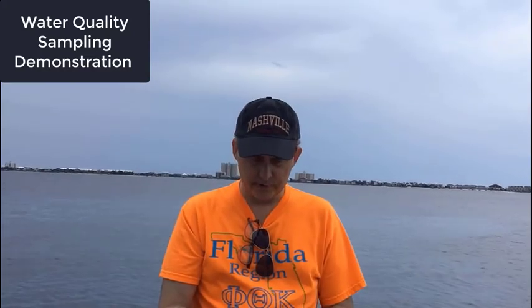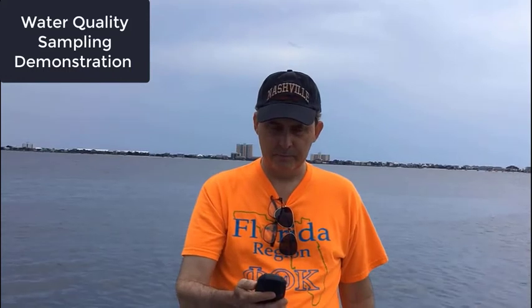The location on there is Shoreline Park South in Gulf Breeze, Florida. You've got the date and time — I'm sure you can figure that part out for yourself. Then we need longitude and latitude. There are a number of ways you can do that; some of you have phone apps. But we have a standalone handheld GPS unit that we're going to use for that today. I'm going to turn that on by pushing the power button and let that come up.